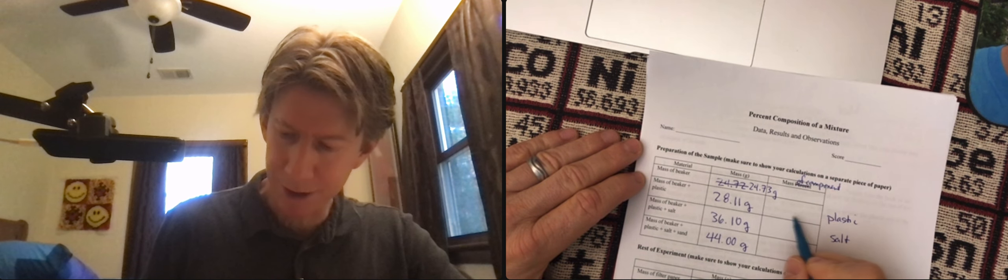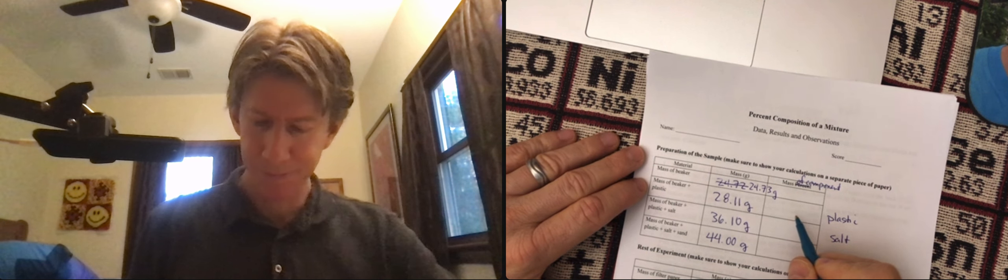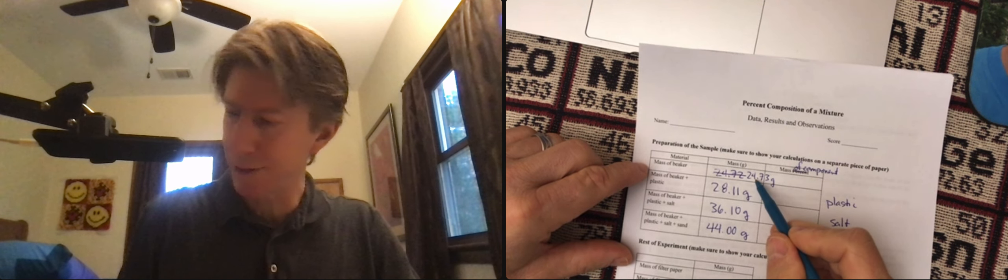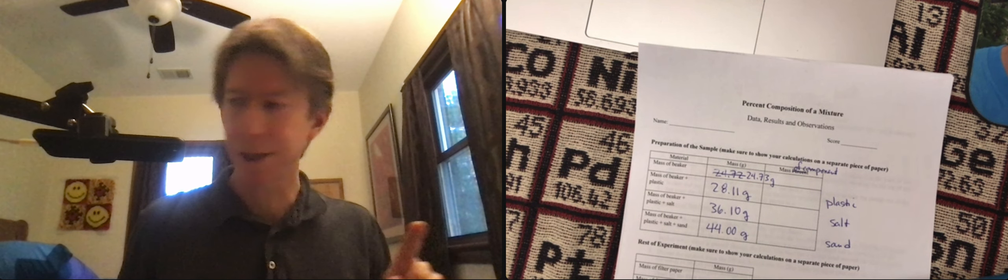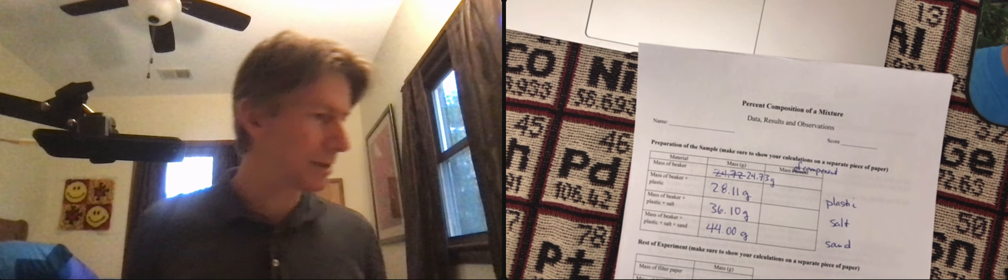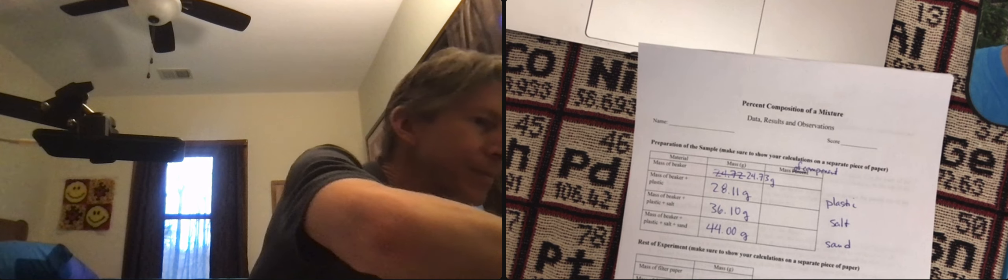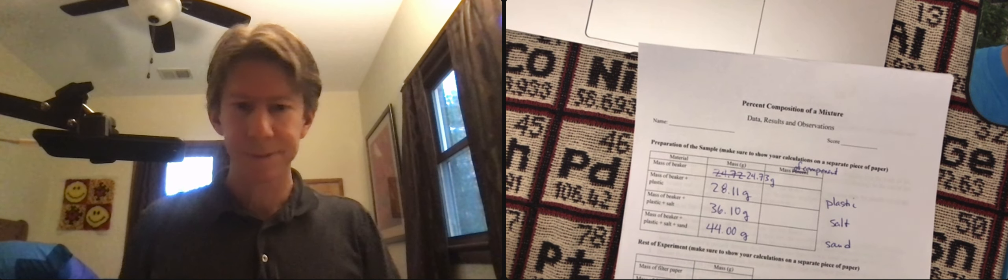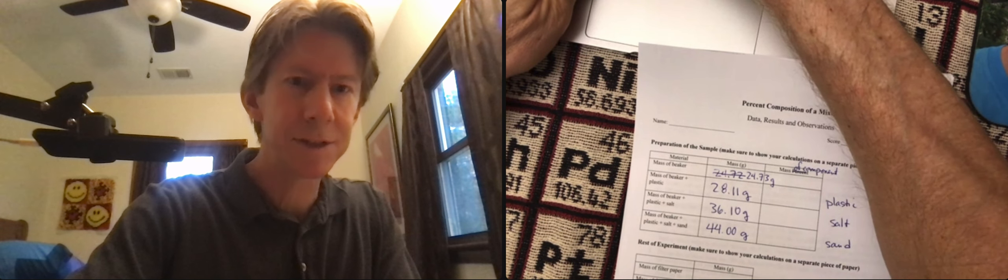So I'm just going to put the mass of the plastic here. And that's going to be the difference between these two numbers. So I'm going to get my calculator. Just a second.